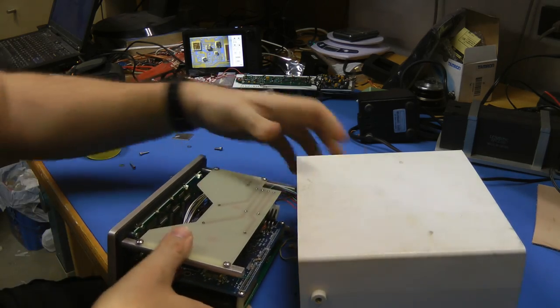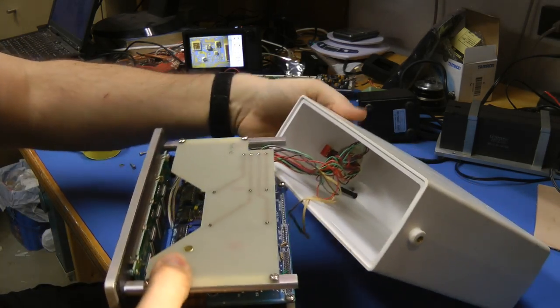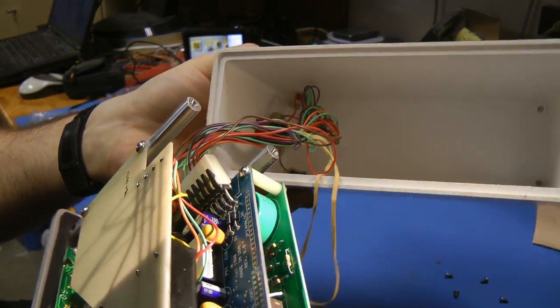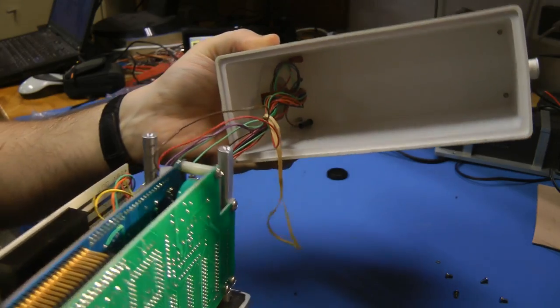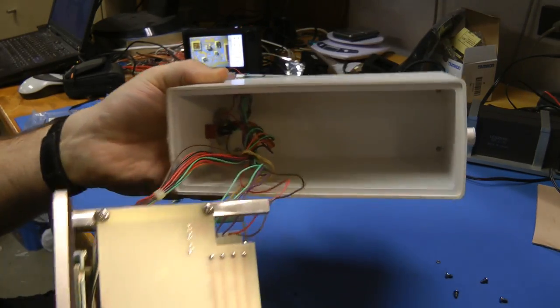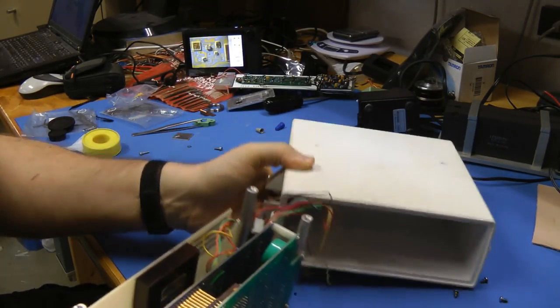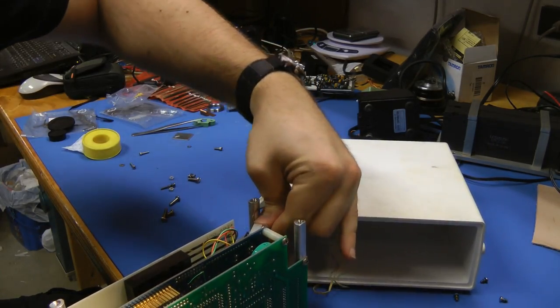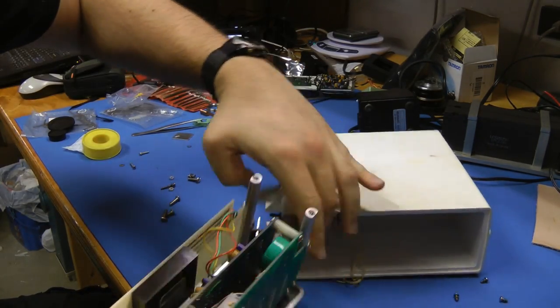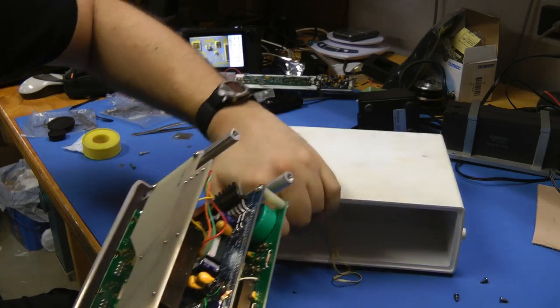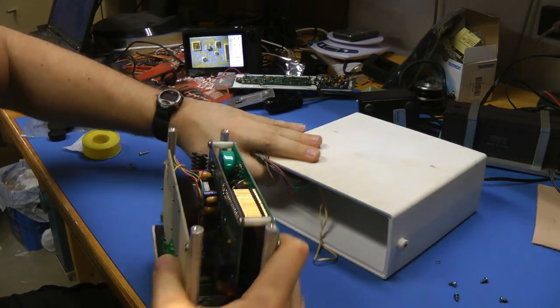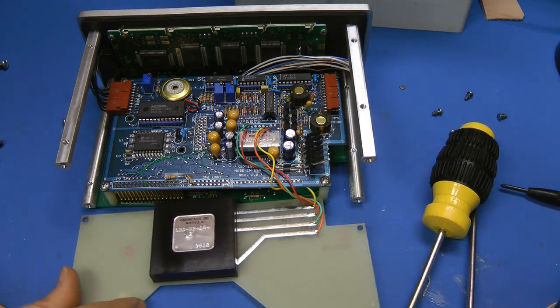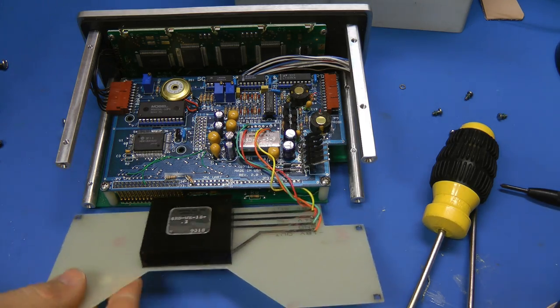There we go. And there's just a bunch of wires. Yeah, just a bunch of wires going off to that connector. There isn't a vast amount in this. Let's see if we can get this off. There we go. Okay.